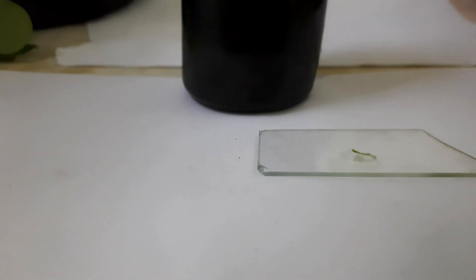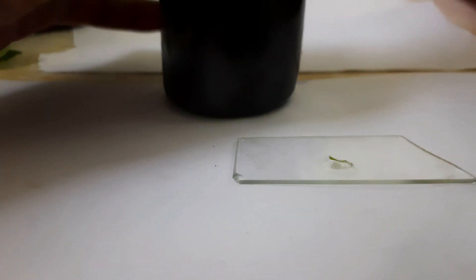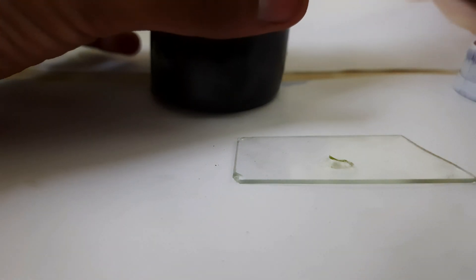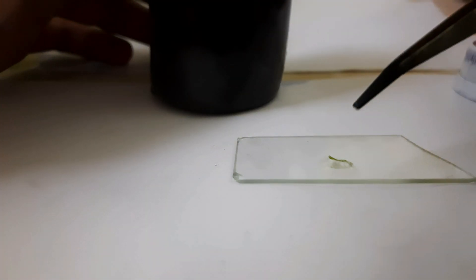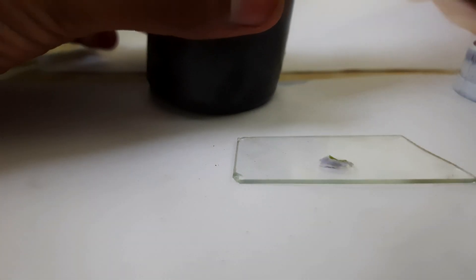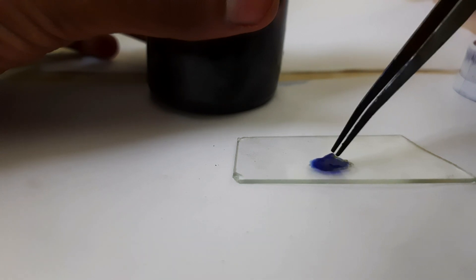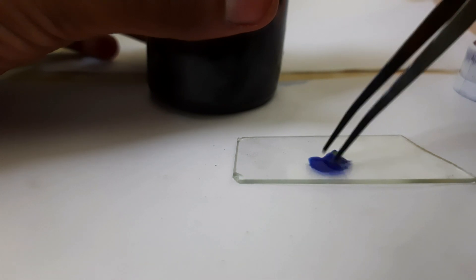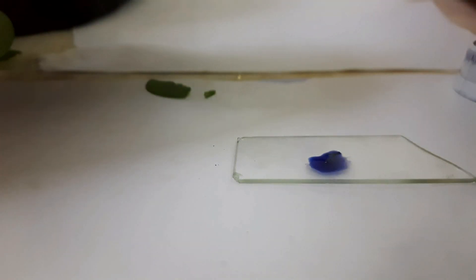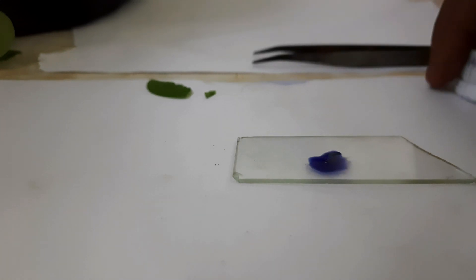As we're not able to view things properly, I'm going to be using some stains. To my disadvantage, I'm not having many stains, so I'm going to use the Leishman stain, which is actually meant for blood — I just showed you that in the last video. I'm going to use a few drops in diluted form so that it doesn't end up being very blue over there.